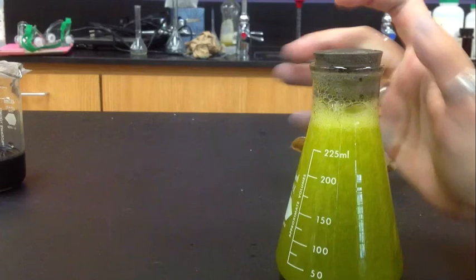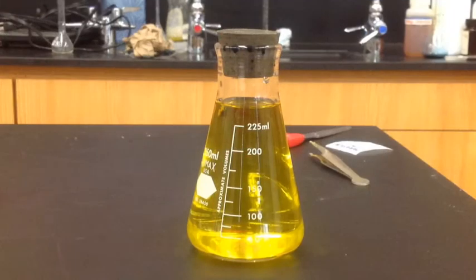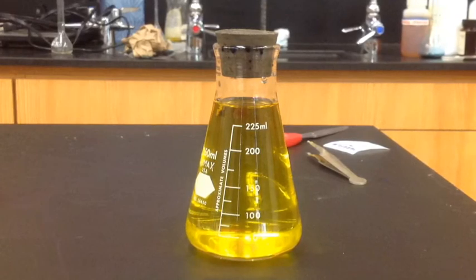At the end, you observed how the green solution faded back to red, and eventually it would even have gone back to yellow. This is because the oxidation of indigo carmine is a reversible reaction. As the oxygen we shook in leaves the solution, the solution returns to its original color.